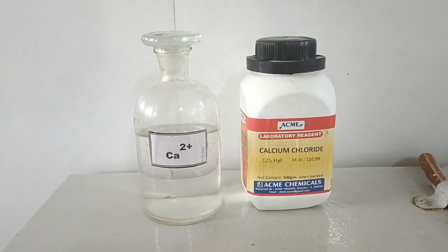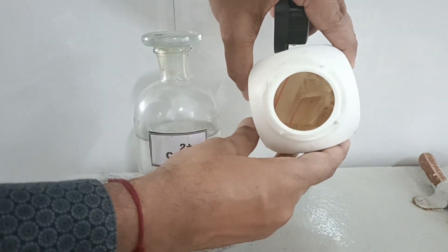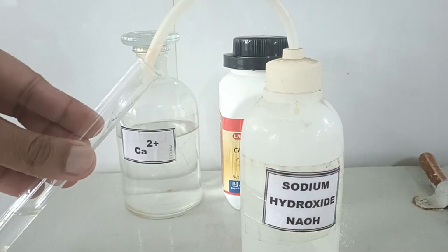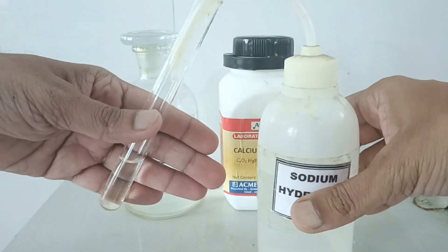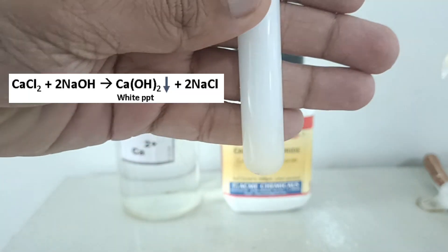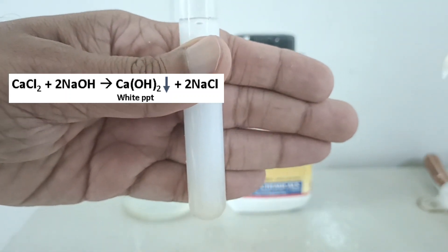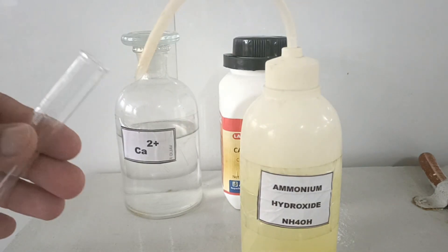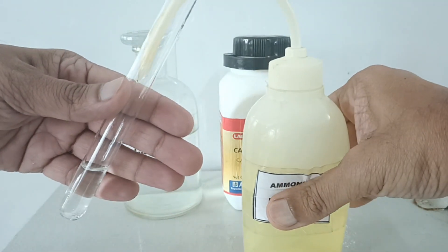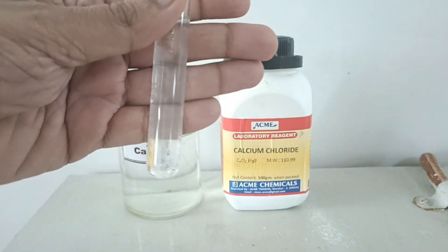Here I have calcium chloride salt. Due to the hot environment, it has converted into liquid state. Let's add about 1 ml of sodium hydroxide solution to the test tube containing calcium chloride solution — white colored precipitates are immediately formed. The same process is repeated using ammonium hydroxide; with small or large quantity of ammonium hydroxide, the solution remains colorless.